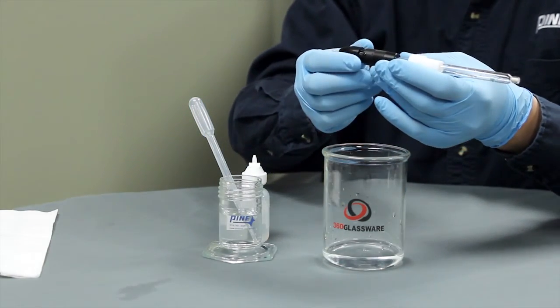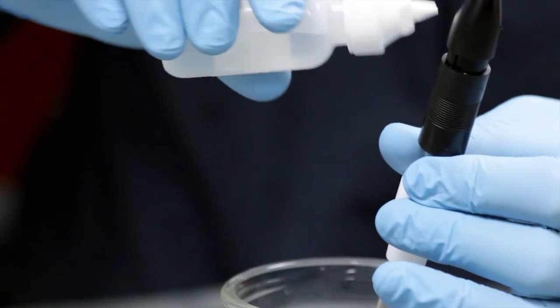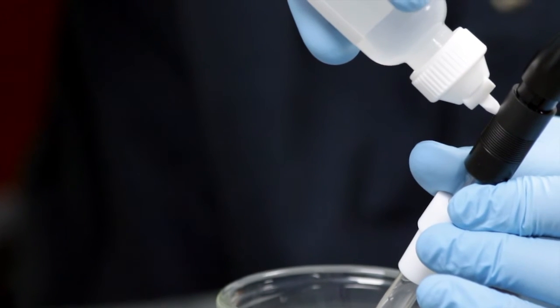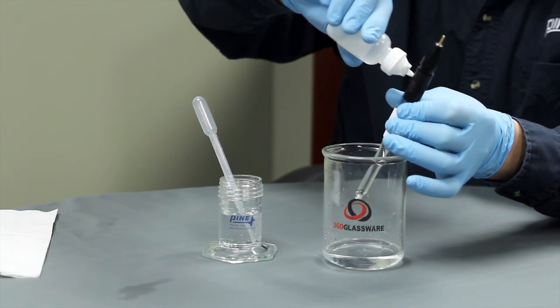Now you should fill the solution with the fill bottle or a plastic pipette. Typically, you'll want the glass tube body filled up to one centimeter below the black cap.